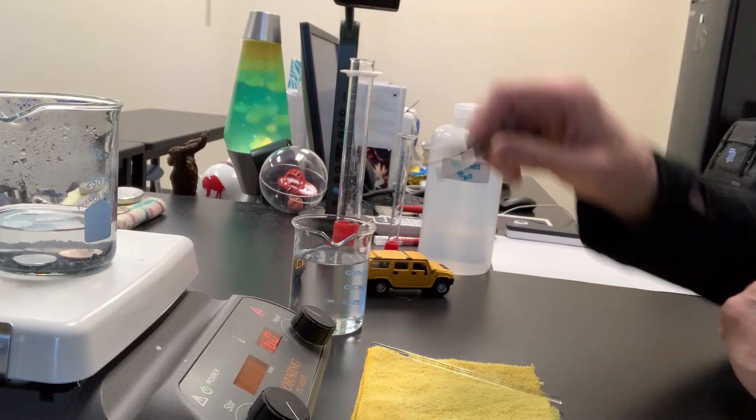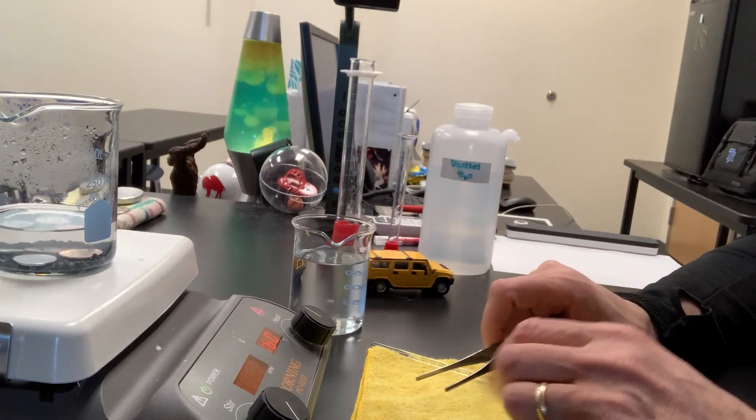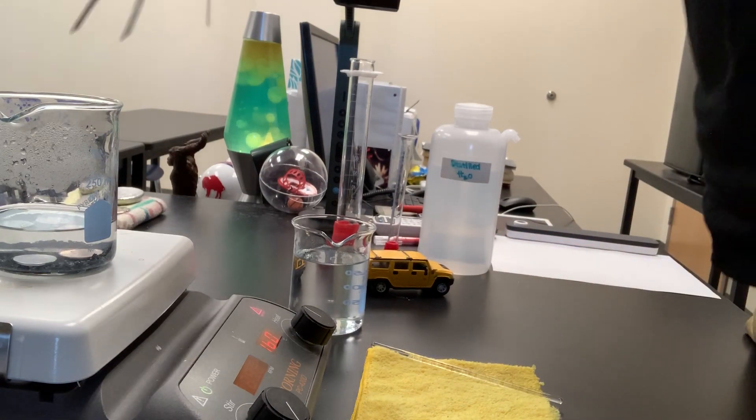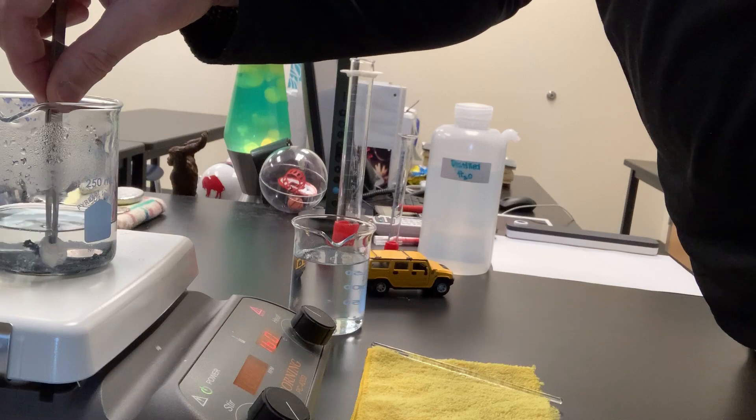Normally I let them sit in there for five minutes before I remove them, but I actually have some pennies that have been sitting here for five minutes already. I'm going to pull those out for you so you can see what they look like.